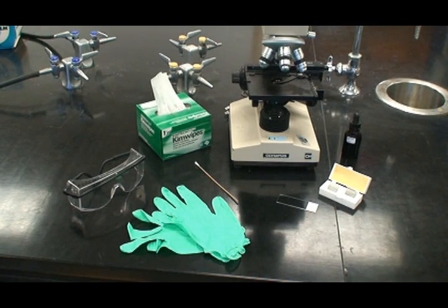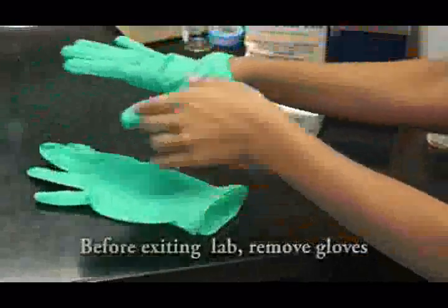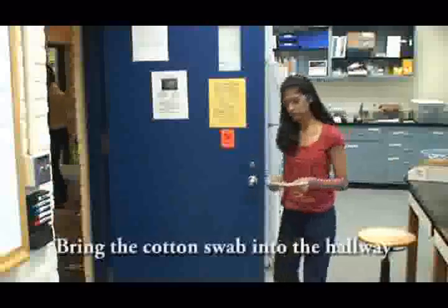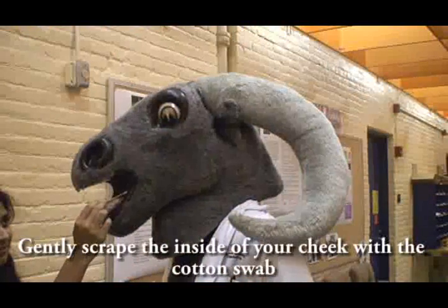The first part of the experiment will be conducted outside the lab, so make sure to remove your gloves and take a sterile swab into the hallway. Gently scrape the inside of your cheek using the cotton tip of the swab.